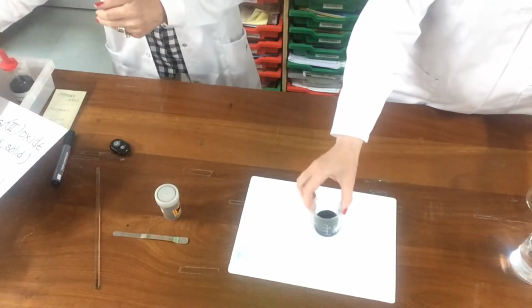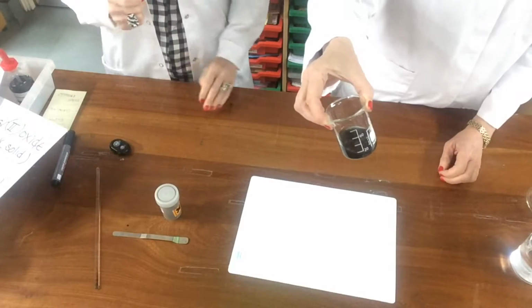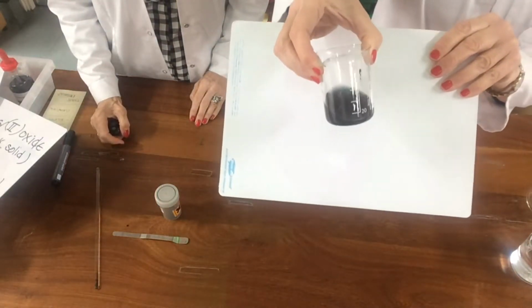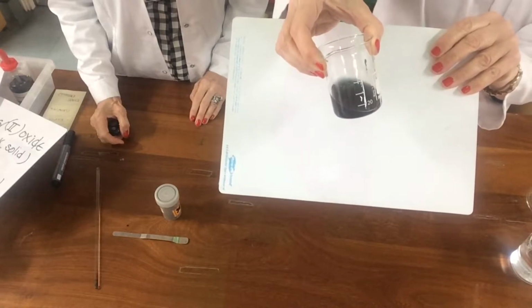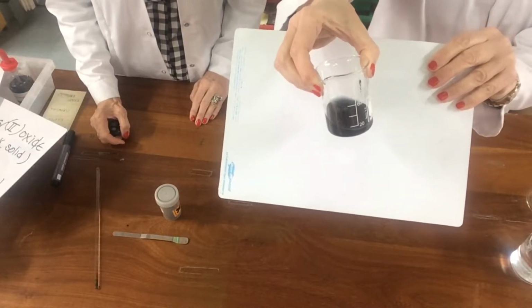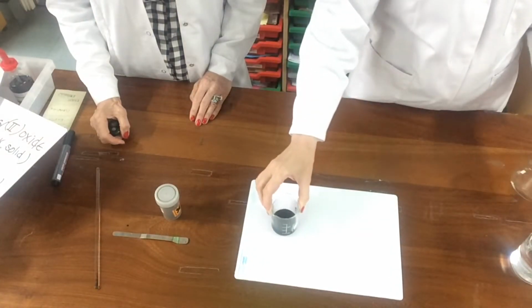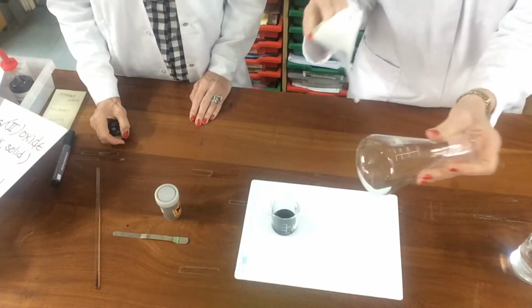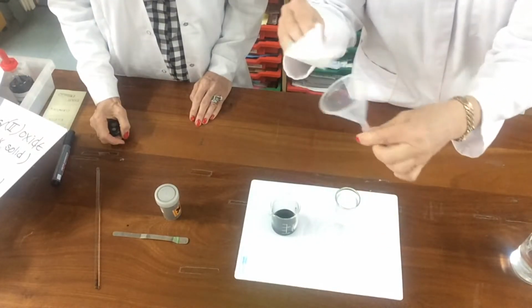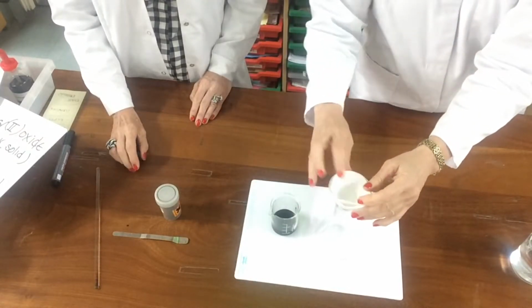So we have the excess copper 2 oxide, which you can see, if I put a background here, there is still a lot of black at the bottom of this beaker, and that's the excess copper 2 oxide, and we have to get rid of that by filtration. So we have the filtration apparatus here, conical flask, you can see the conical flask, we have a filter funnel and the filter paper, and it's very simple.